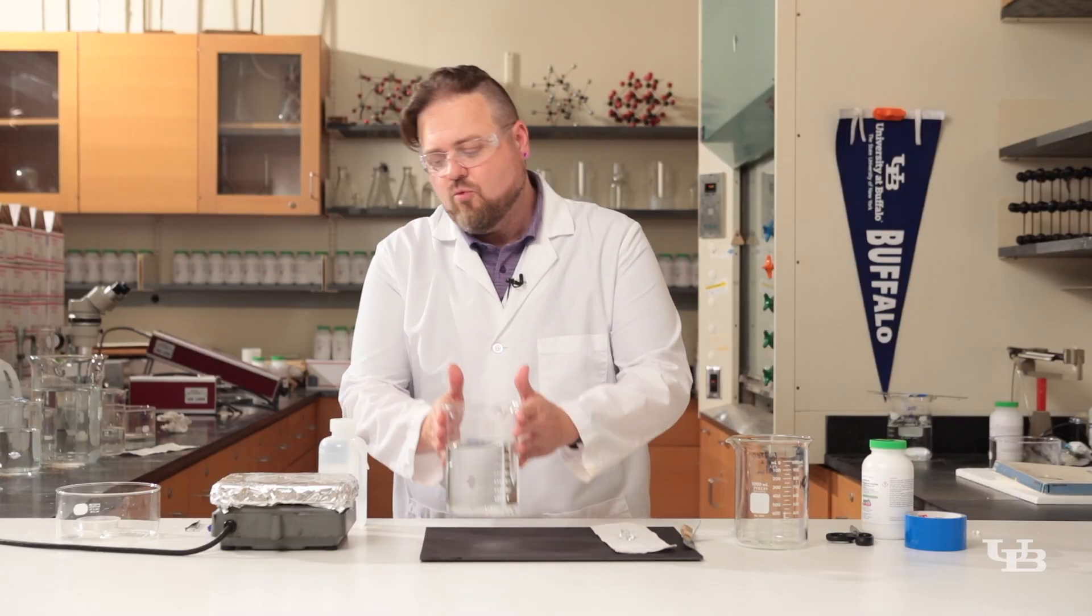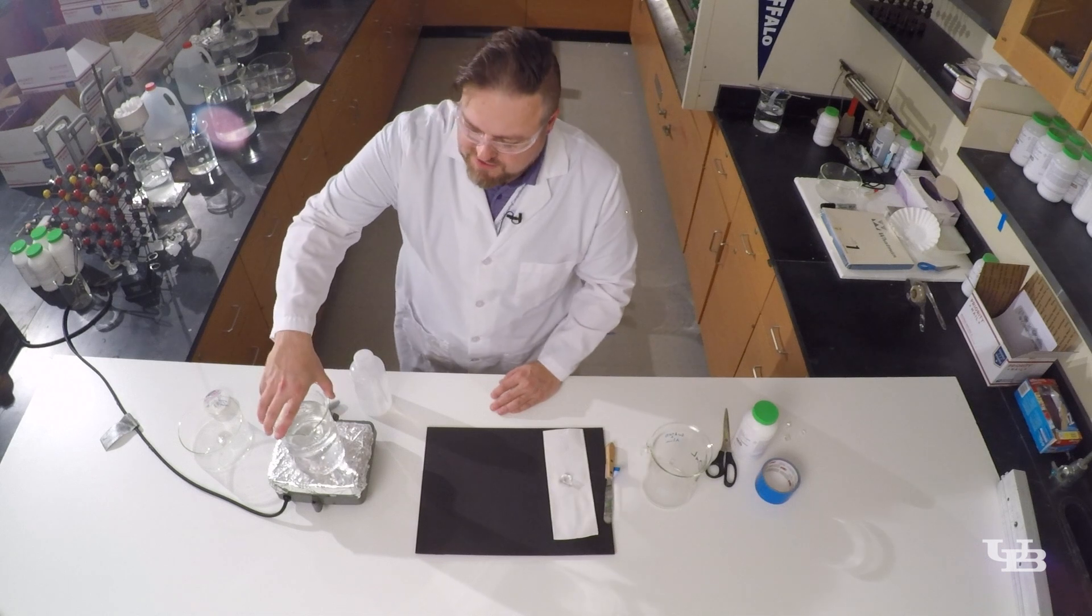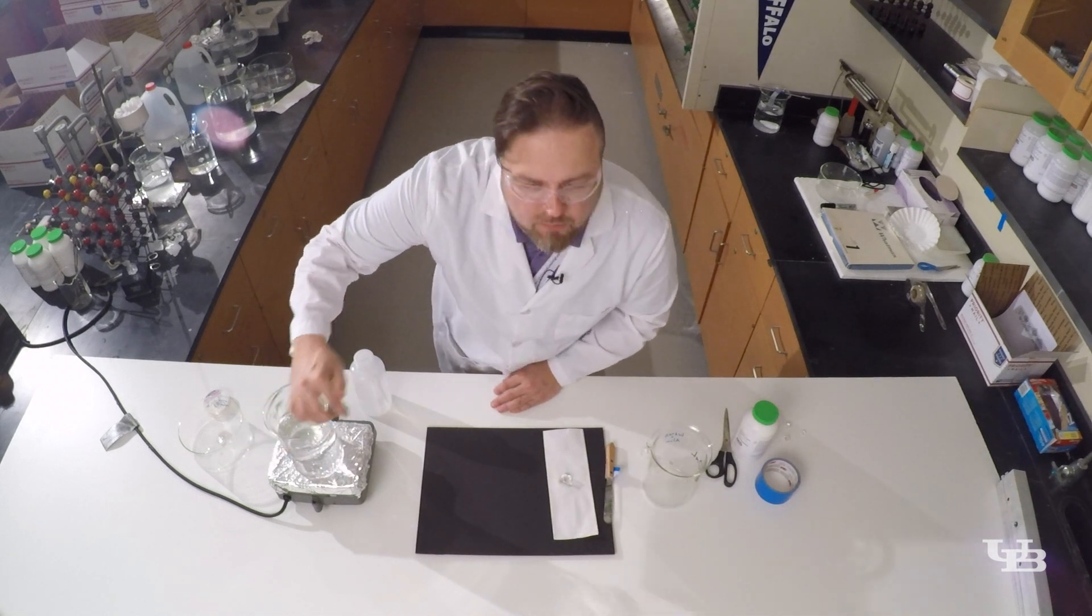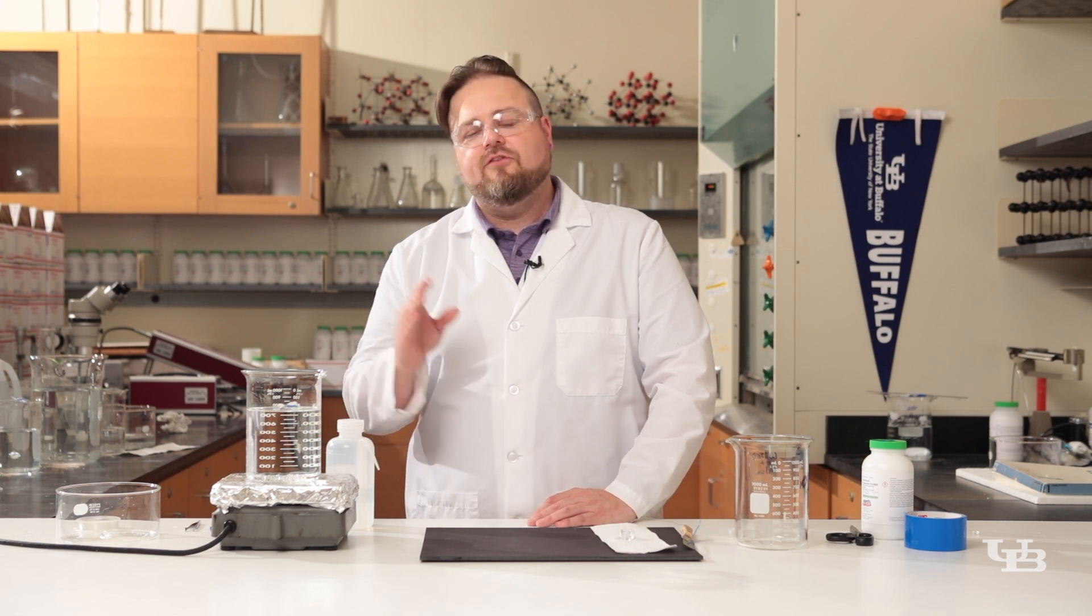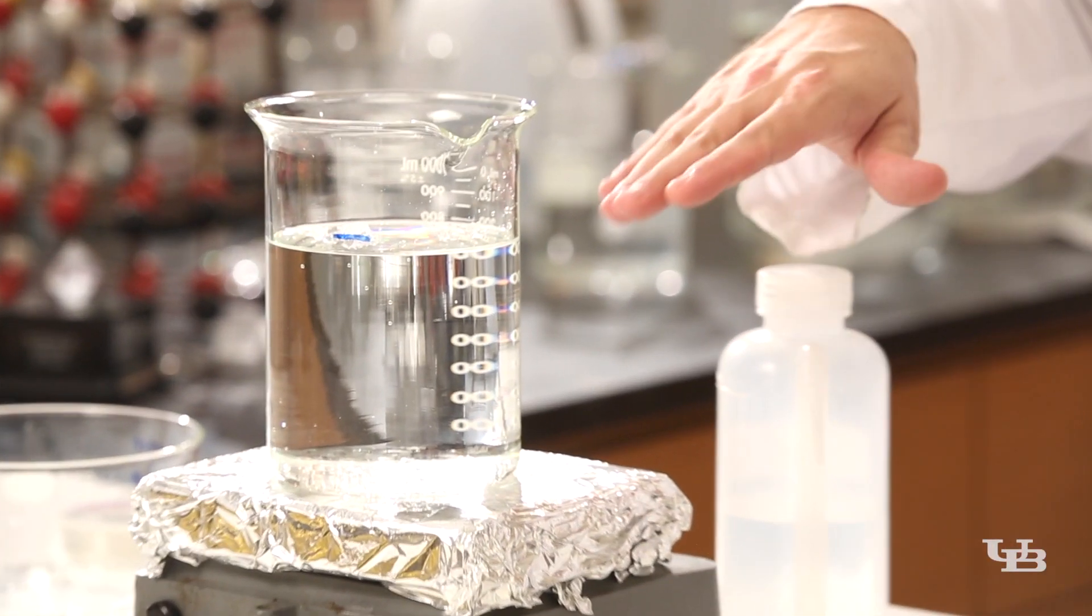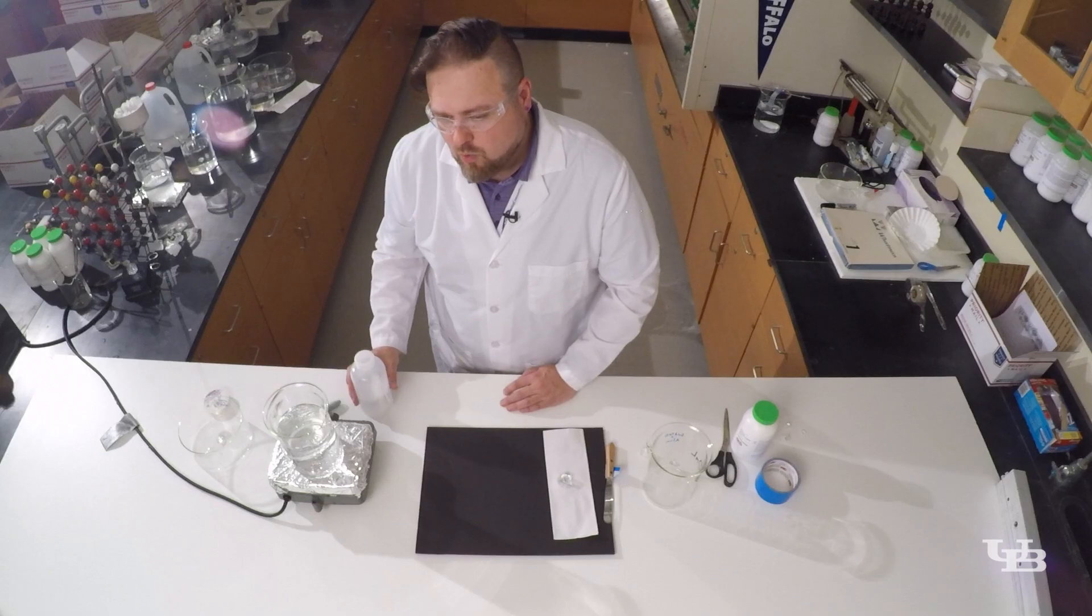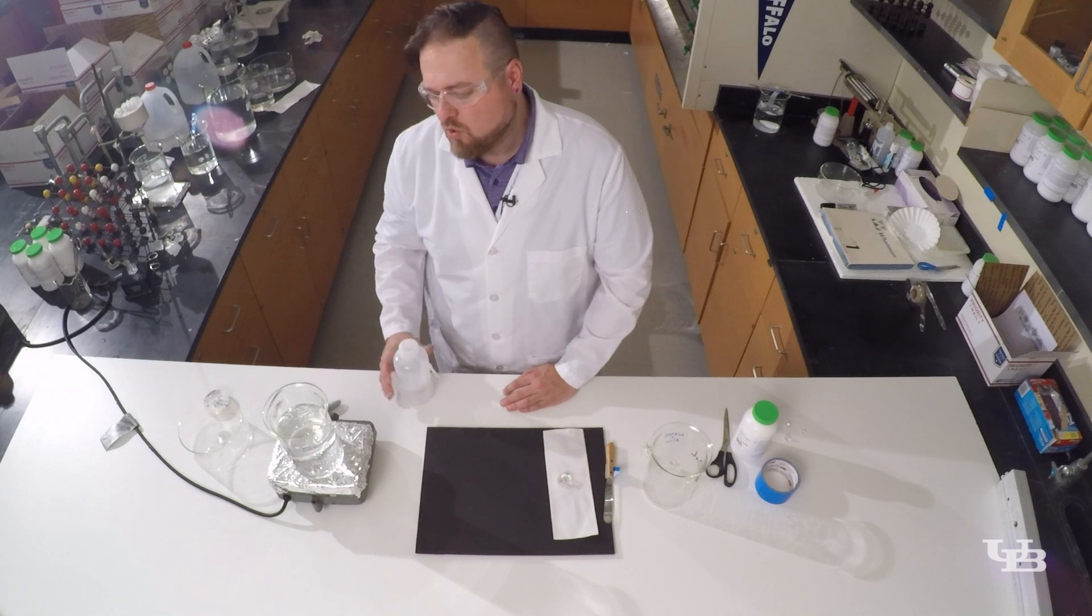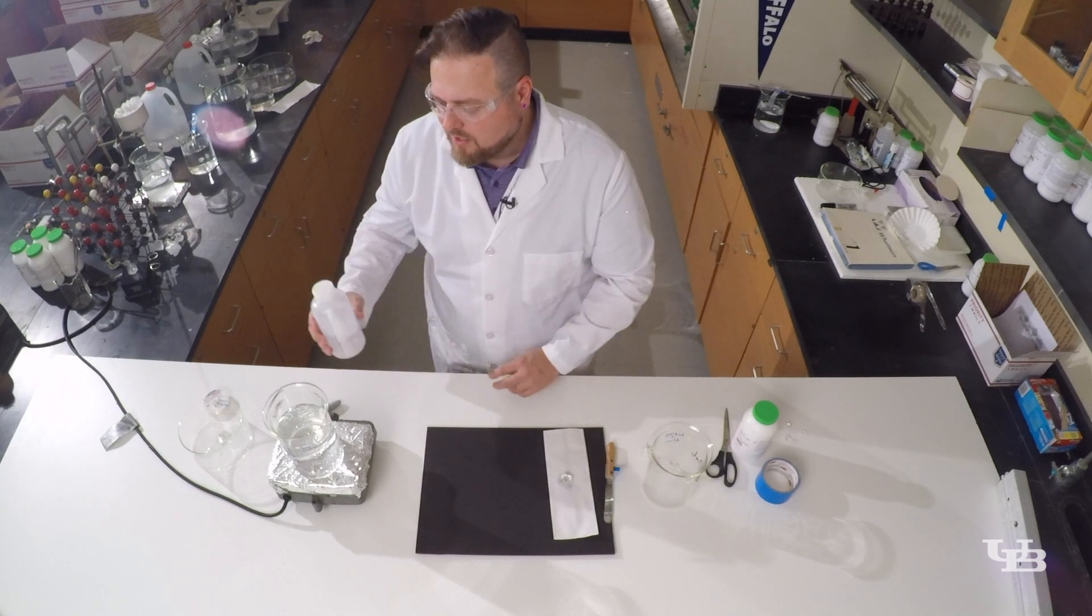We have our solution, we're going to put it on a hot plate and this is where we're going to want to pay attention to our blue line again. Once again the amount of water is critical. This blue line represents the amount of water that was present when I first introduced the seed crystal. We're going to want to add back in some water to this solution but not quite to the blue line.